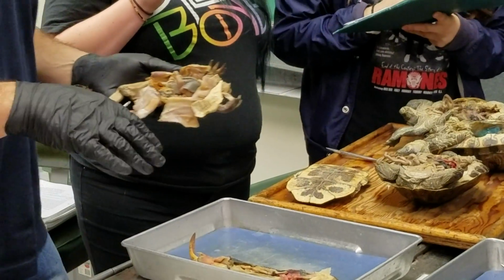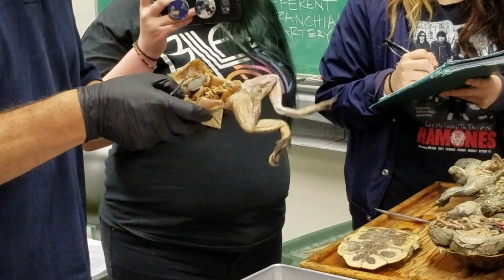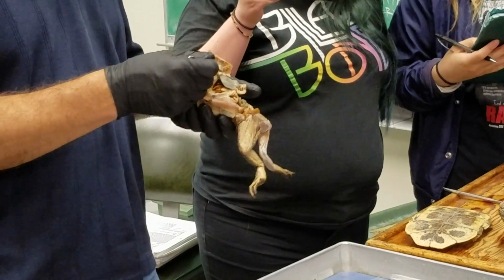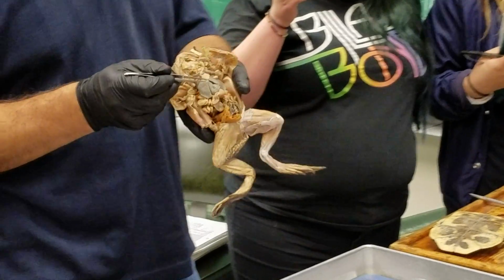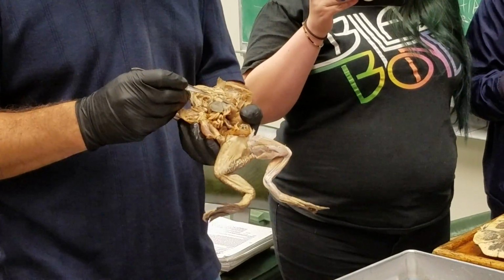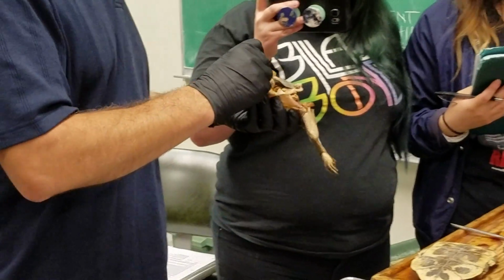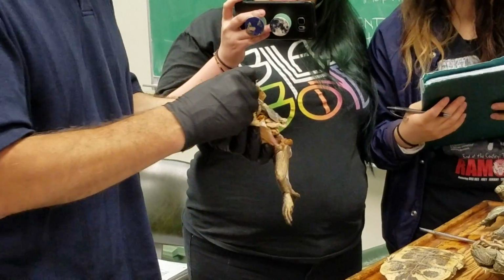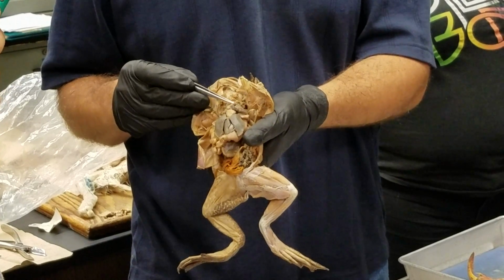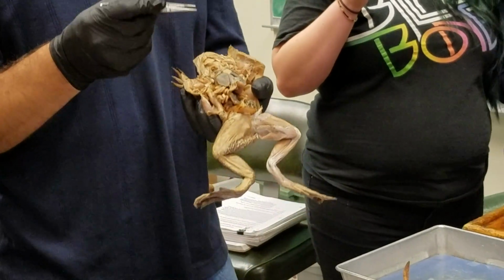Frogs. So in the frog, as I mentioned in general for tetrapods, what we see is a little bit different looking. Okay, here's the frog, and it's got a heart, the ventricle, and there's the atria, ventricle, atria, left and right. And what you'll see coming out of the frog's heart then is this conus arteriosus, which is this swelling here. And then that kind of branches on either side into the truncus arteriosus, which is a common stem that's then going to give rise to those three main arches.